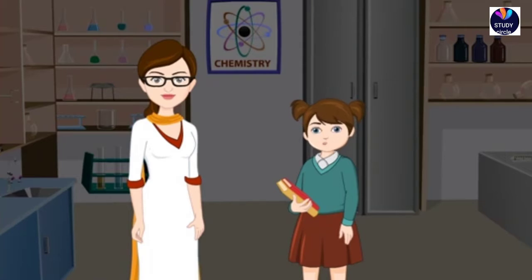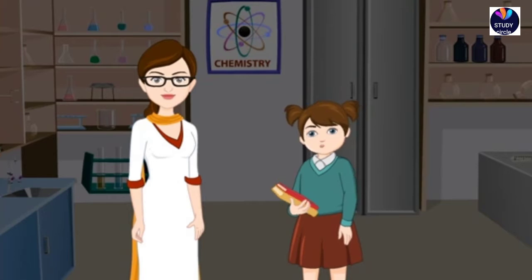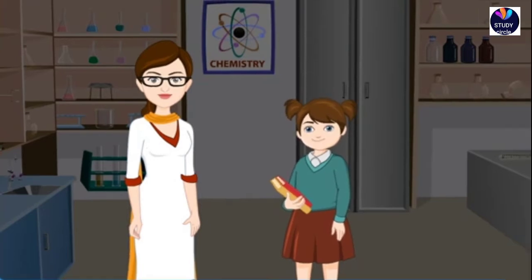Madam, how will you detect the presence of nutrients like starch, proteins and fats in food? Let's do an experiment to test the presence of nutrients in food.